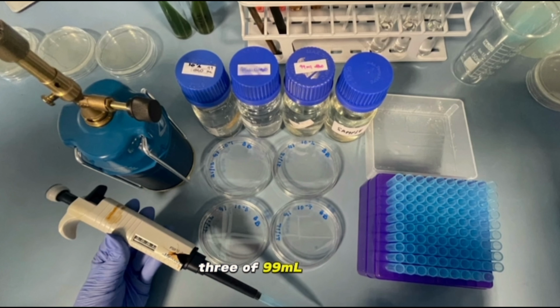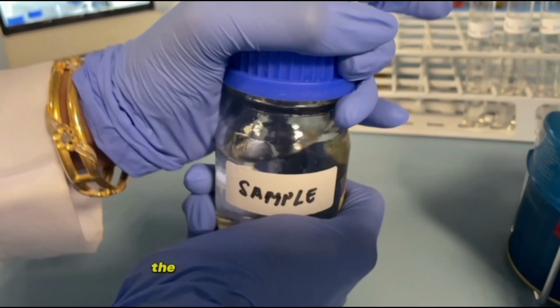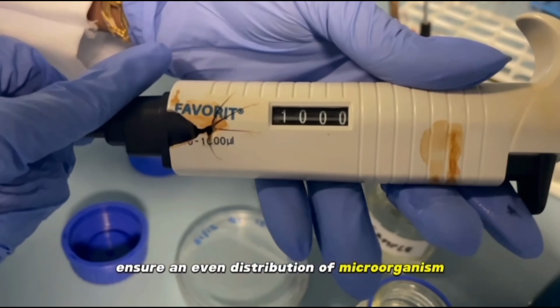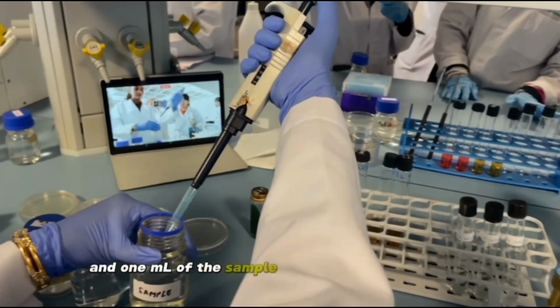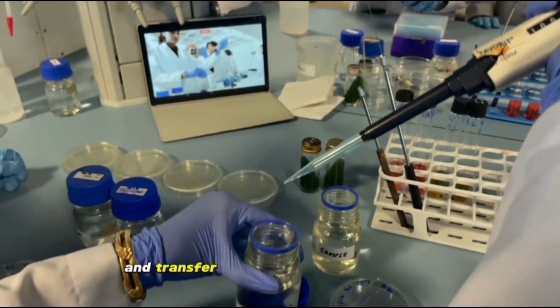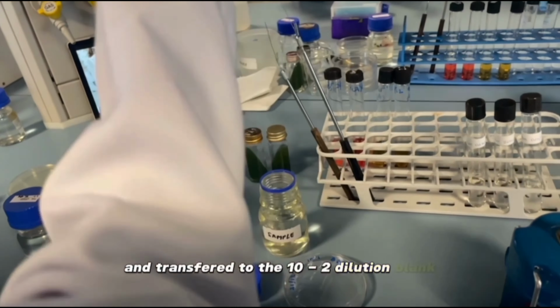Three 99 ml dilution flasks were labeled as 10^-2, 10^-4, and 10^-6 respectively, while the 6 petri plates were labeled from 10^-1 through 10^-6. The unknown sample was shaken to ensure an even distribution of microorganisms, and 1 ml of the sample was aseptically removed with a sterile pipette and transferred to the 10^-2 dilution flask.